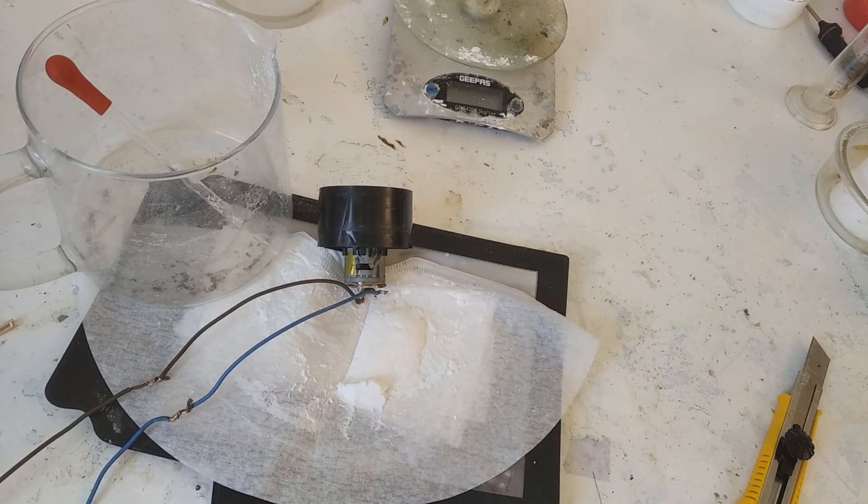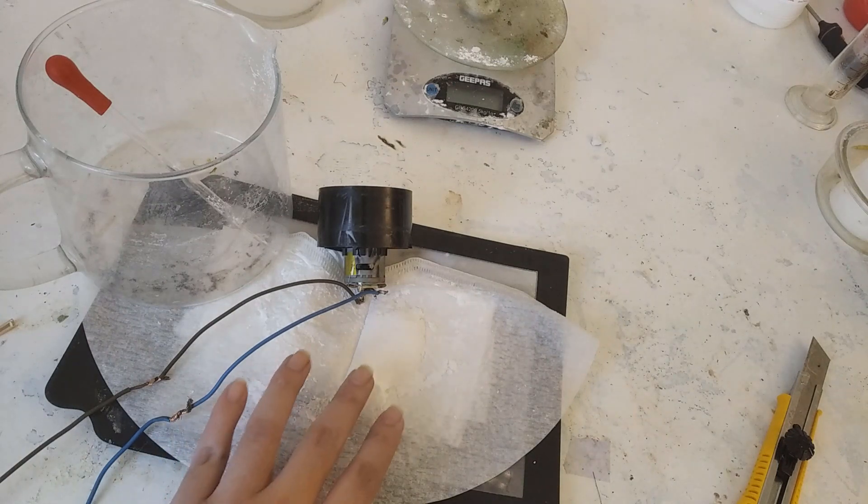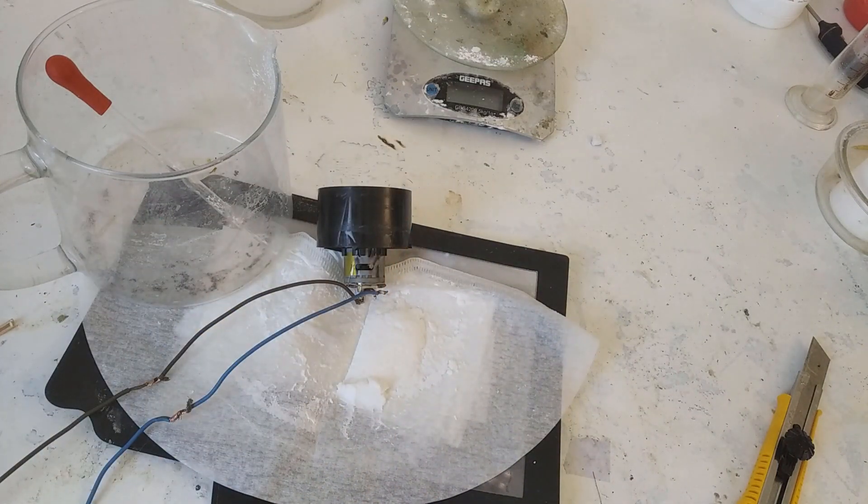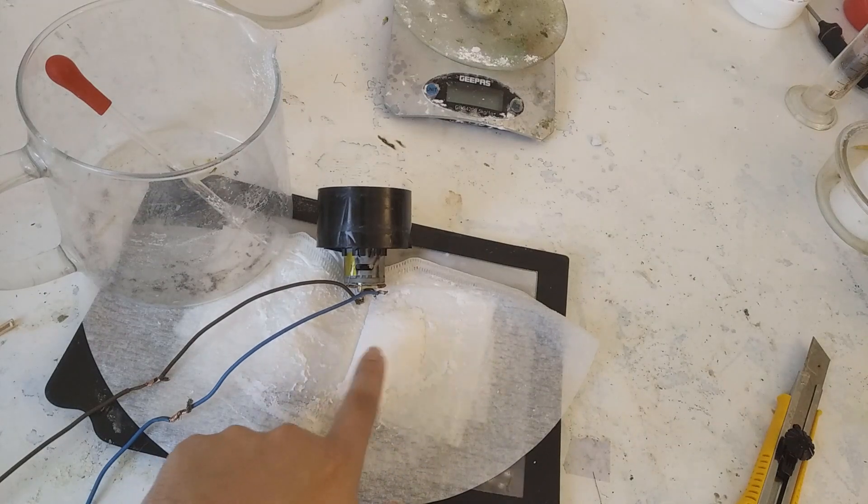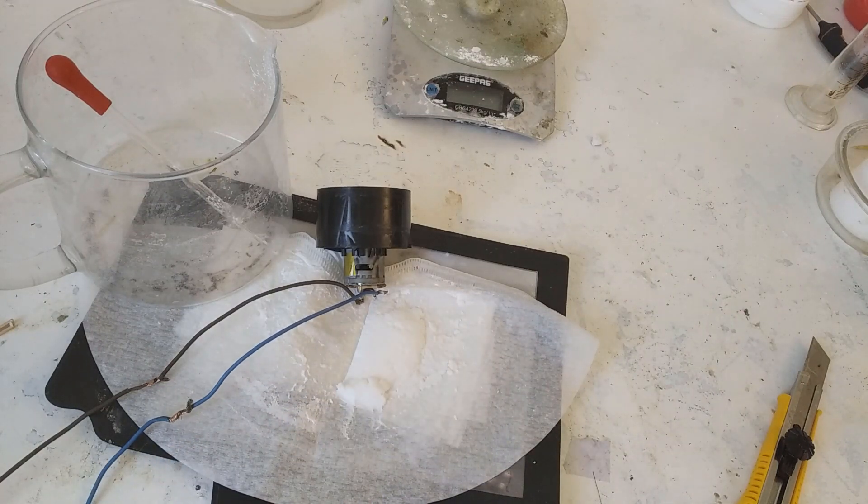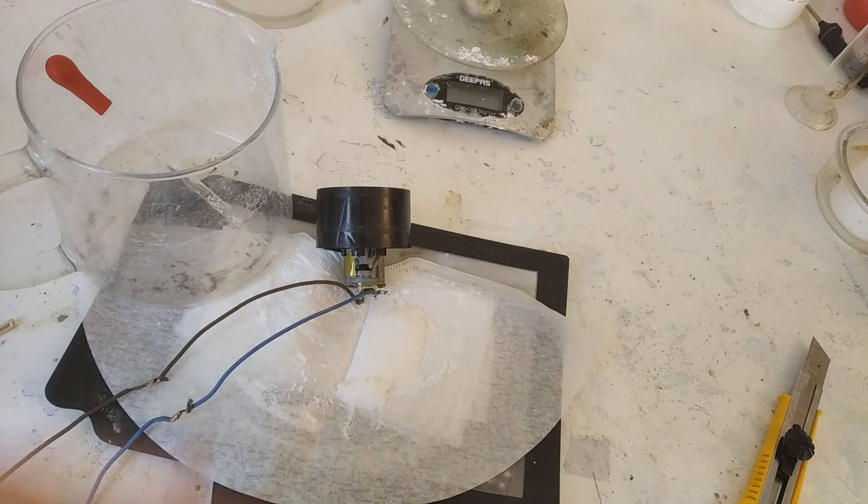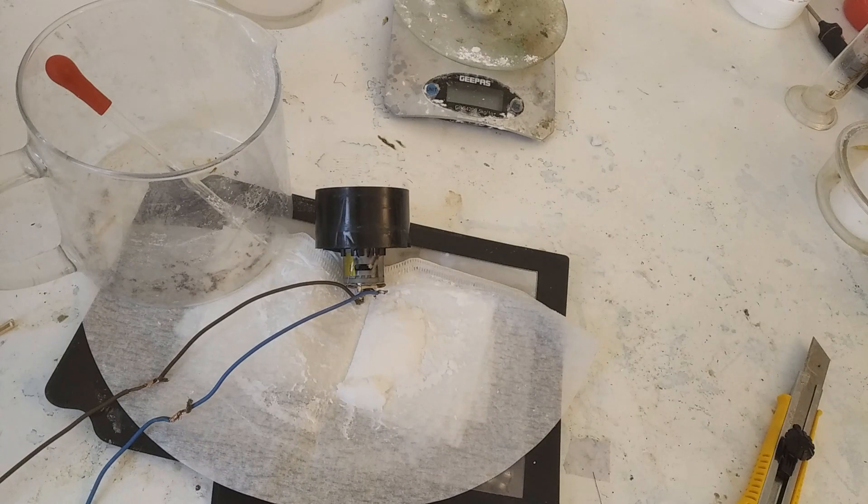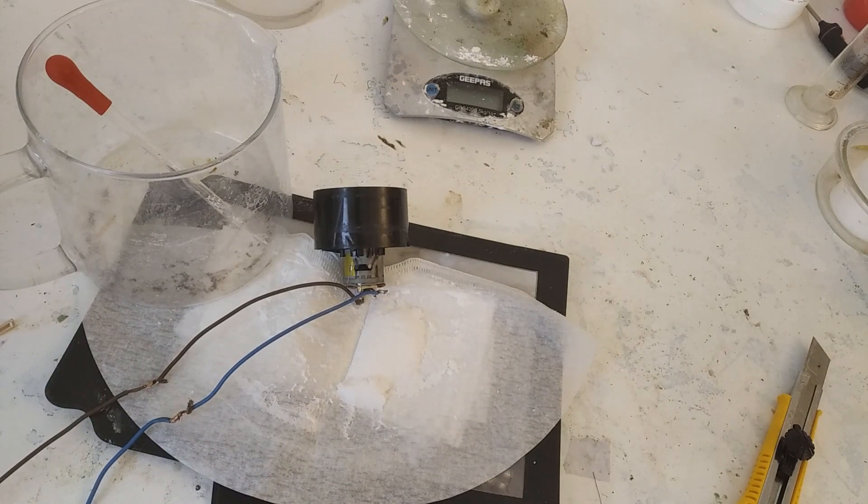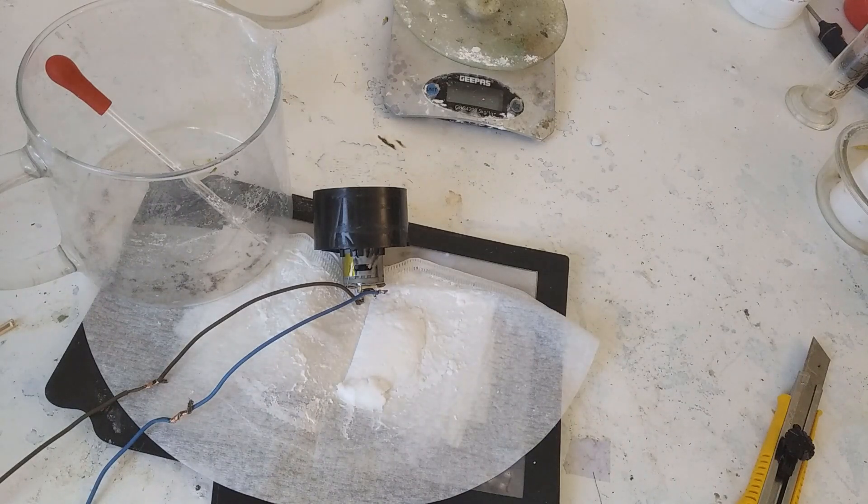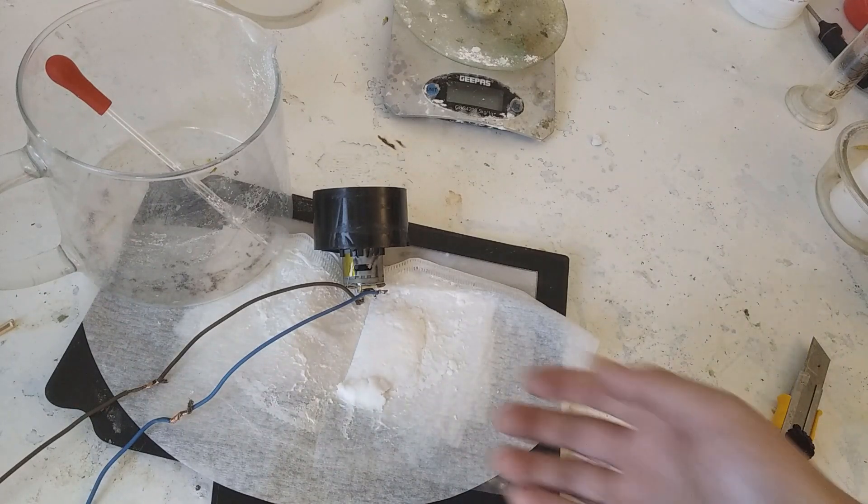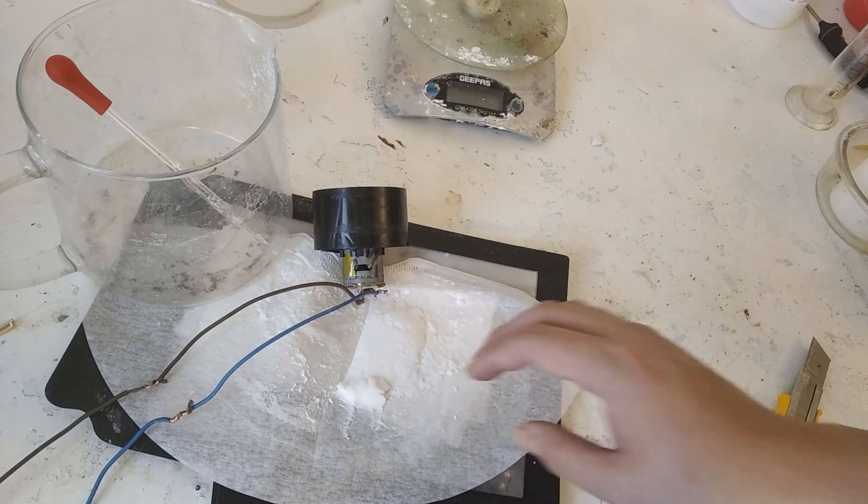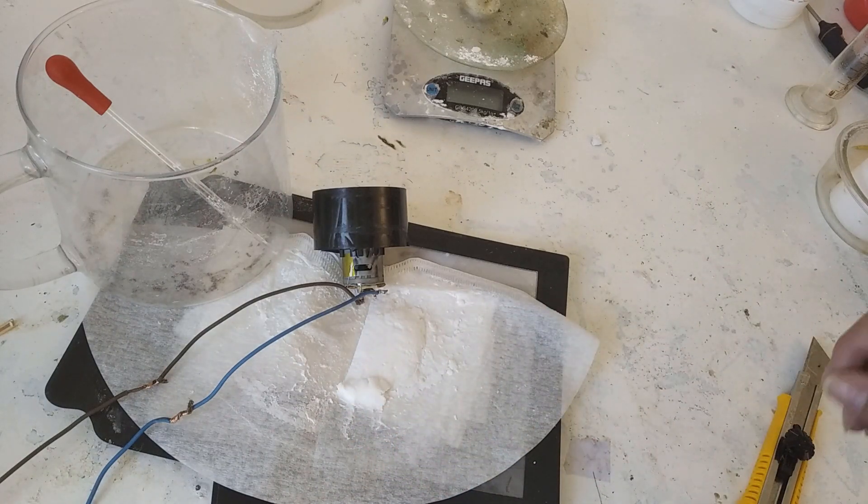I know this sounds horrible but I need to dry this thing faster so I employed over here a little bit of part of the broken hair dryer I had and I'm using the fan to essentially blow on the ethanol. Let's increase the voltage about 9. 8, 8's good enough. 9 makes this thing shake violently. So yeah hopefully I don't blow my product everywhere, that would suck.